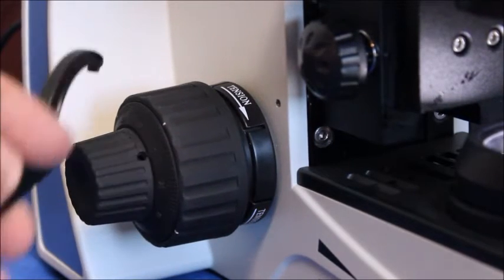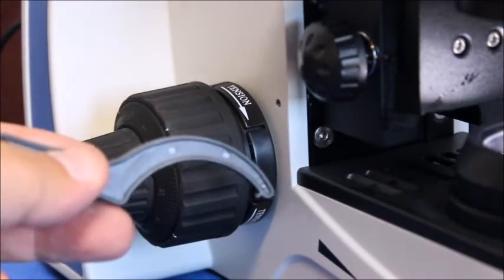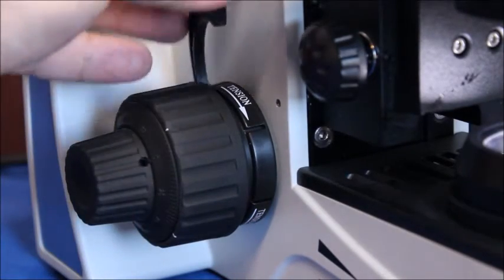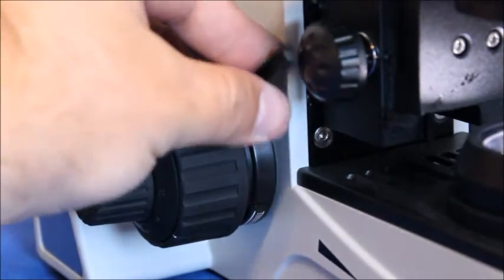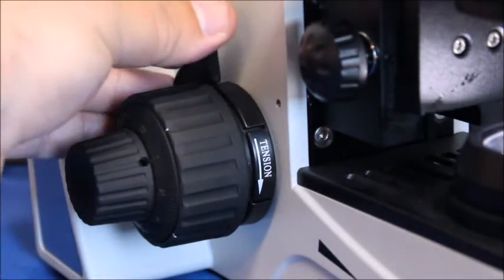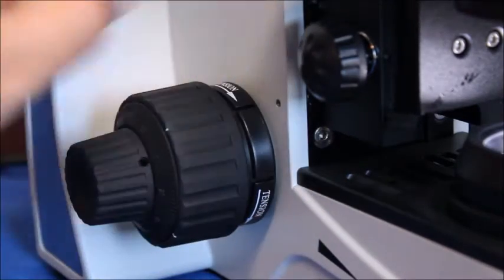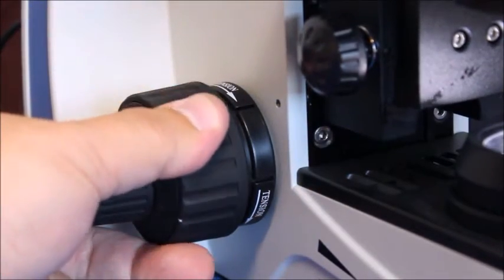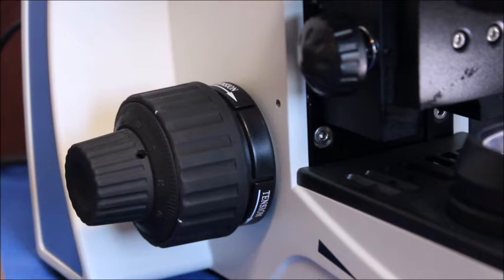You can see how it's falling down on its own right there. And you get this tool and you put it in the groove there and you just pull it right along. Give it a little bit of turning until you feel a little bit of resistance and now it'll stay in its place.